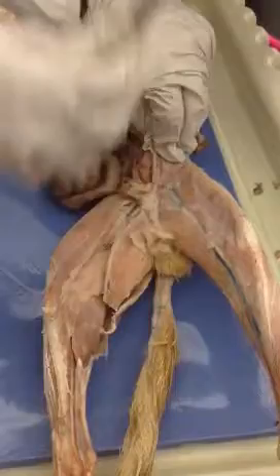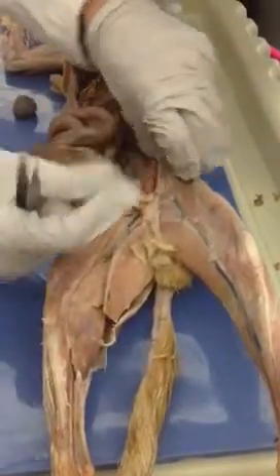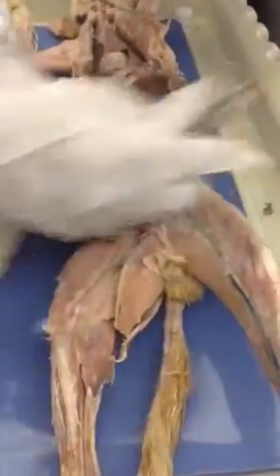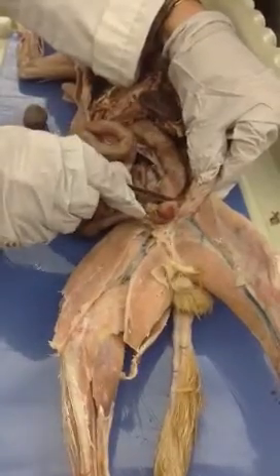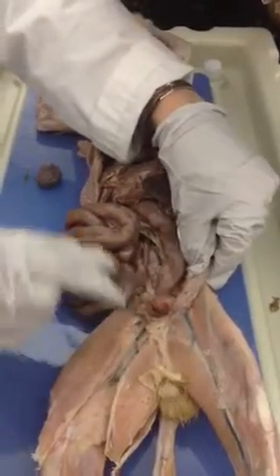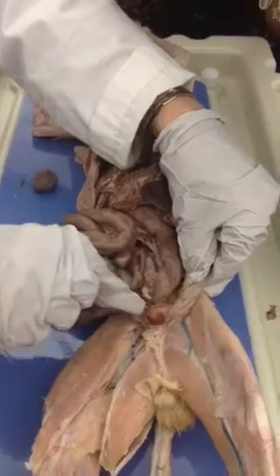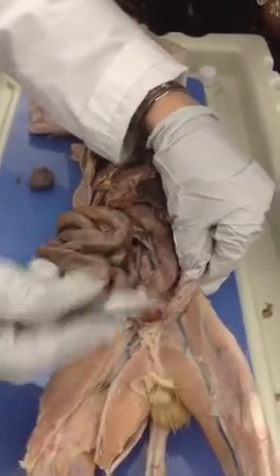And there'll be something like a toothpick through there. I put a toothpick through mine, and I have a card that says opening. And then when it comes out, what you're looking for here, in terms of the reproductive part, is the little tube that's going to curve over. It almost looks like an artery, but it's not. And so this is the vas deferens. So that comes from the spermatic cord, comes up, and goes over the ureter that's right here. So this is the vas deferens, goes around it. So anything that loops over the ureter, that's the vas deferens.